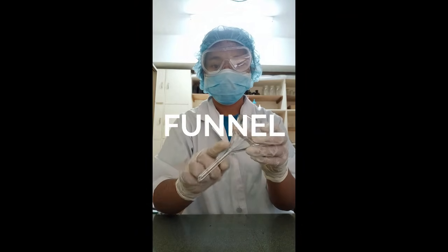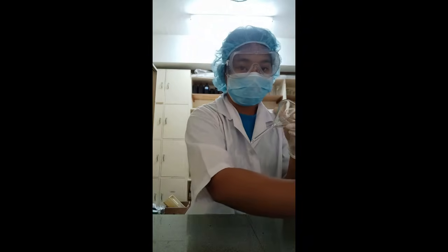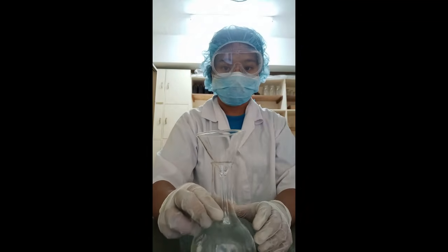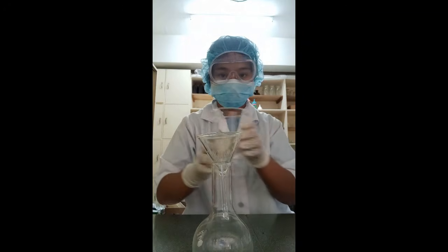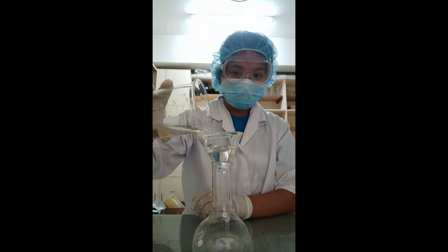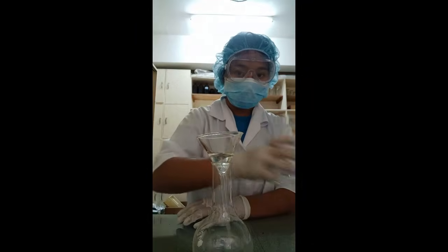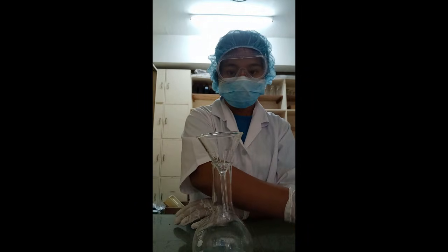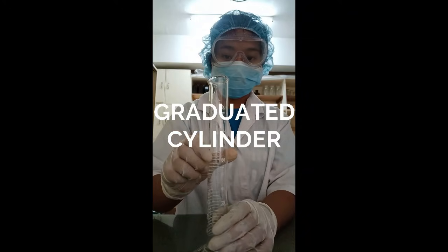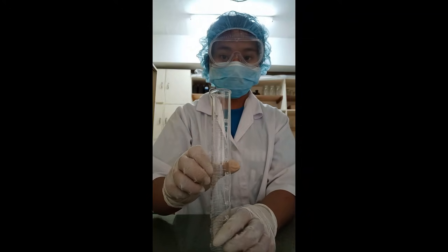Funnel. It can be made of plastic or glass. It can either have a short stem or a long stem. It comes in several sizes based on the amount of liquid that needs to go through them quickly. Graduated cylinder. It is a measuring tool for the volume of a liquid.